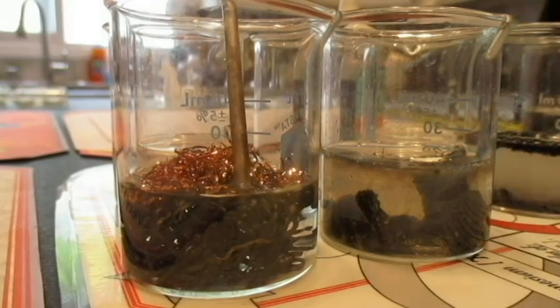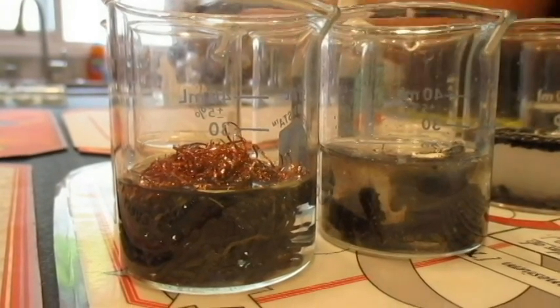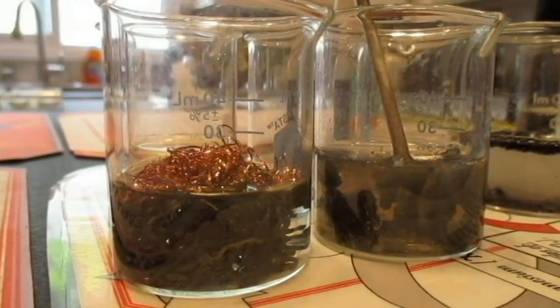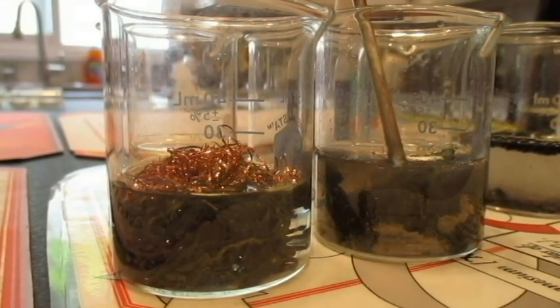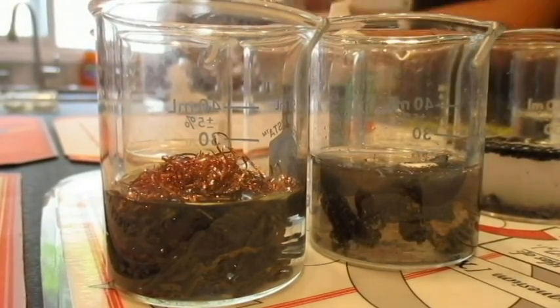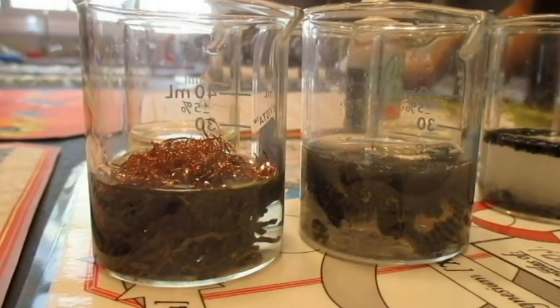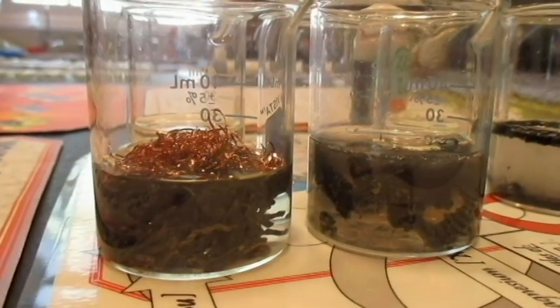24.0. So a very small, if any, change of temperature. Now wipe it off and then put it in the other one. This one is 26.0 Celsius. Okay, so there is a change of temperature. So for some slow chemical reactions, you might not get a real dramatic bubbling or anything. But I do see signs of chemical reaction. What's the biggest sign that something is happening here?